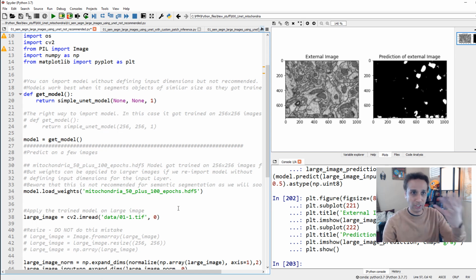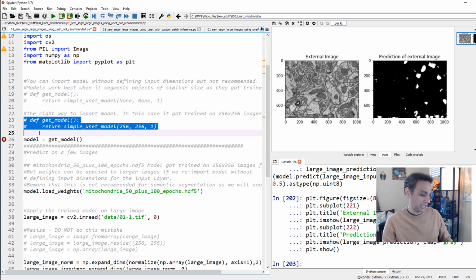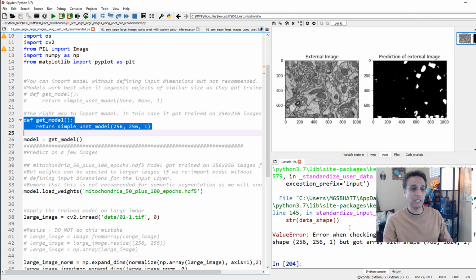I mean, logically that doesn't work. You see the result over there. Now, the other mistake that people make, okay, let's go back to our original, right? If I go back to this and if I run, it should not run because it says, okay, hey, you have 256 by 256 and the shape is different.